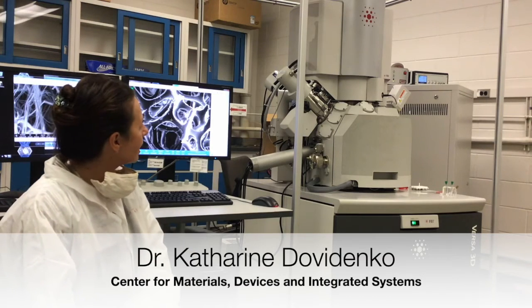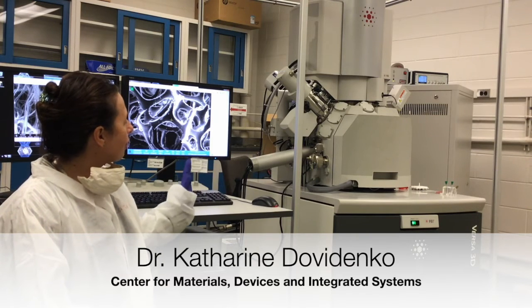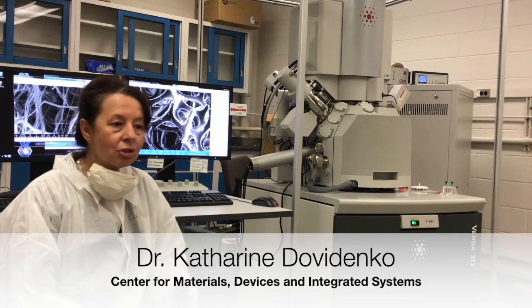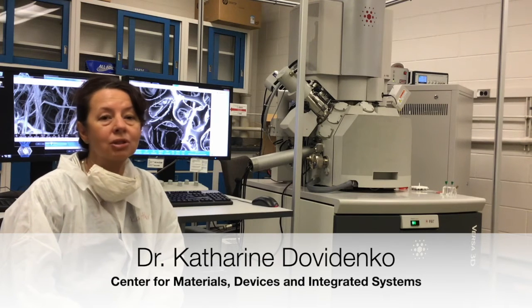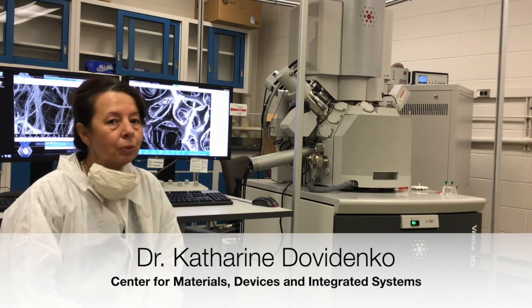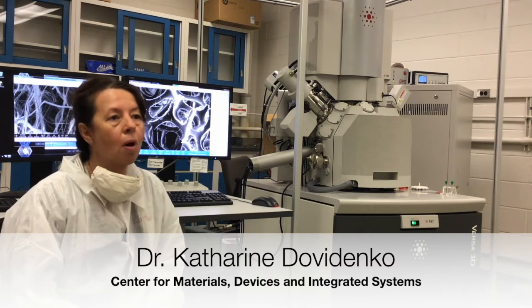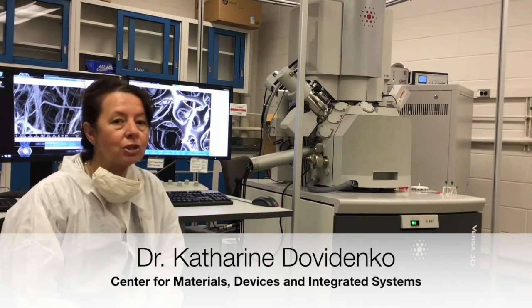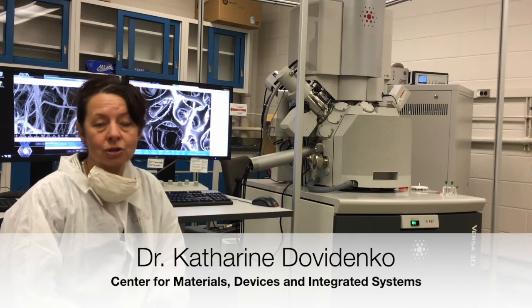So this is our scanning electron microscope, focused ion beam microscope. It has multiple very interesting attachments that allow us to do more detailed analysis. Materials analysis can show us topography, can show us morphology, can show us what the material is made of. If we take an example of, let's say, iPhone, there are multiple different materials that are utilized to make the iPhone. So case would be made, for example, from some aluminum alloys. Electronics has very, very different set of materials, and more interestingly, device properties that are needed for device to function.